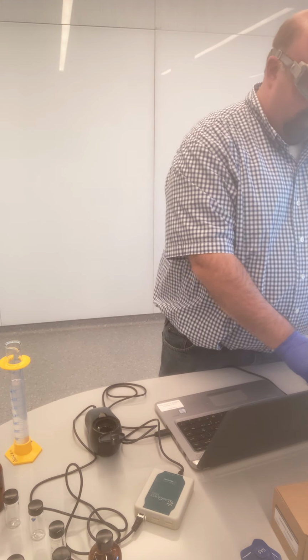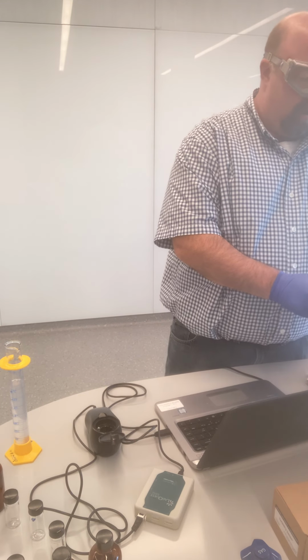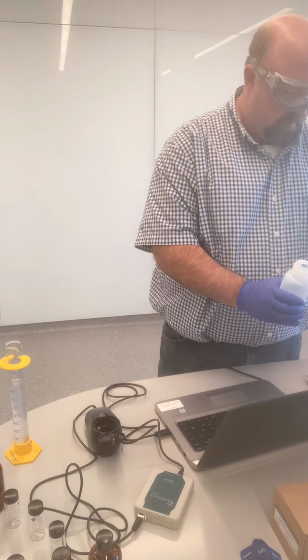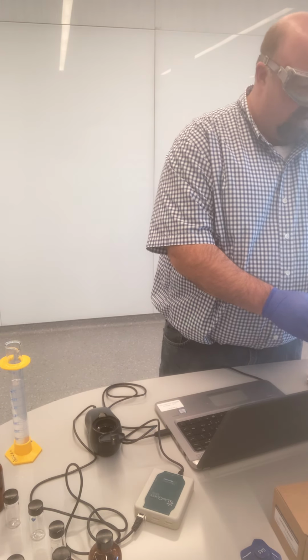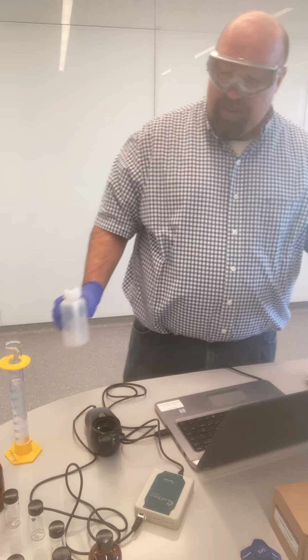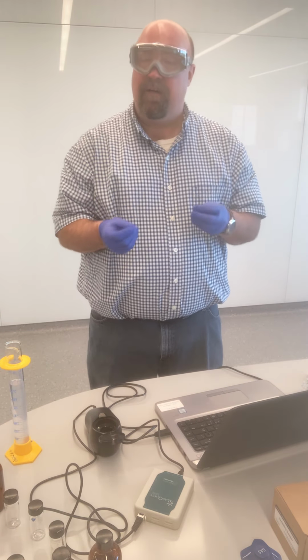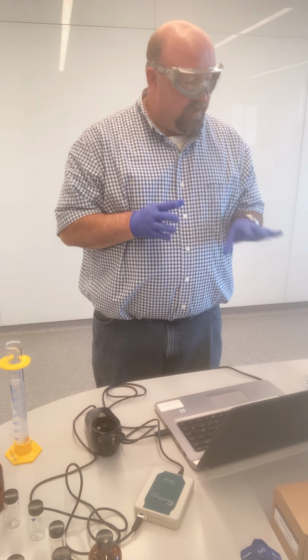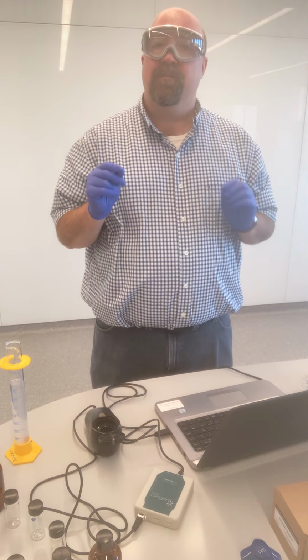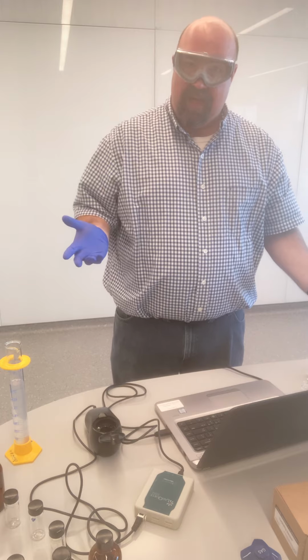Now, keep in mind that what you're going to be doing for your analysis is finding the average of those 3 measurements, and that will be your turbidity value for sample spot 4. And so that's going to be roughly, again, you're going to find the actual average, but that's going to be roughly 33 or so, 33.2, 33.4, something like that. Keep in mind, though, that when you find that, that represents a 10-fold dilution of the actual sample. So whatever number you find for sample spot 4, when you take this average, you have to then multiply that by 10. That will get you back to what it really was sitting in the flask.